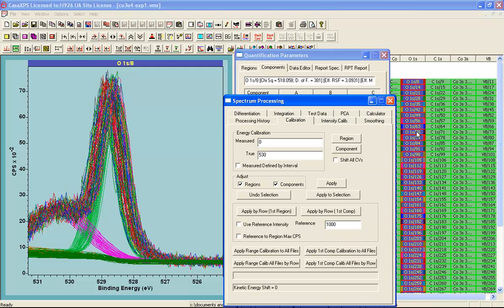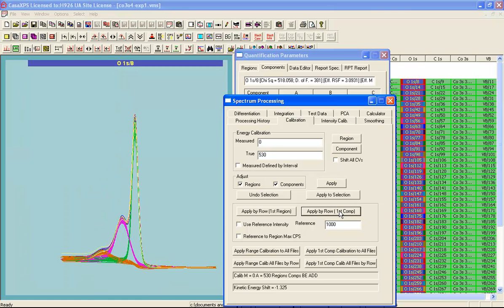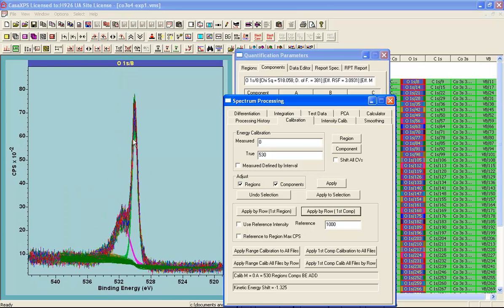And then I can do this calculation that will apply to each row based on this first component. So the only column I have selected, in which all of the oxygen spectra have the same peak model defined in the same order, this will allow me to apply by row first component an offset that will apply to each row. So I'm going to press this button, and we can now see from the display that all of these components align within the oxygen, and by virtue of the apply by row first component, each spectrum within each row of this data file for which the oxygen are selected will now have the same offset applied that aligned these components.